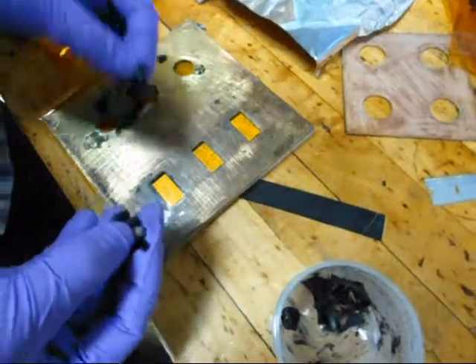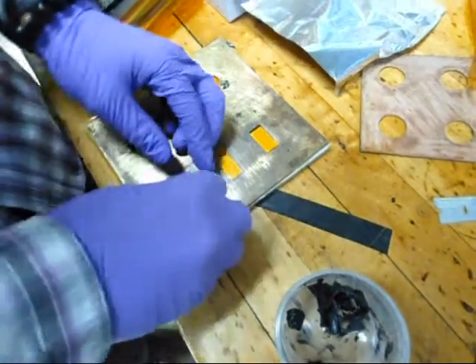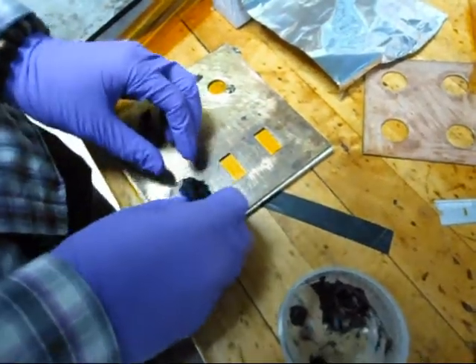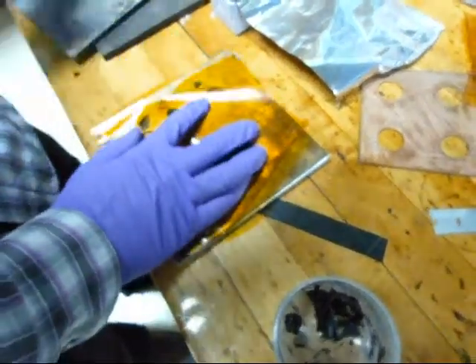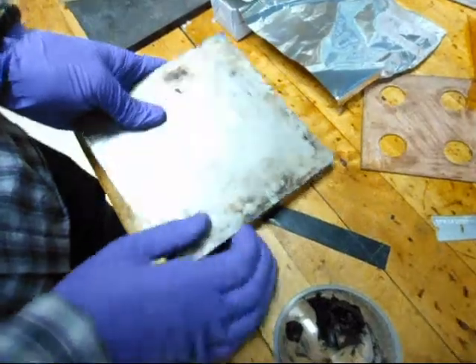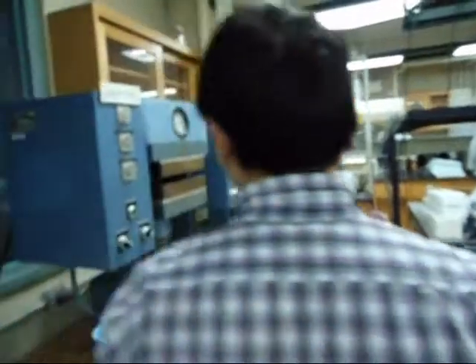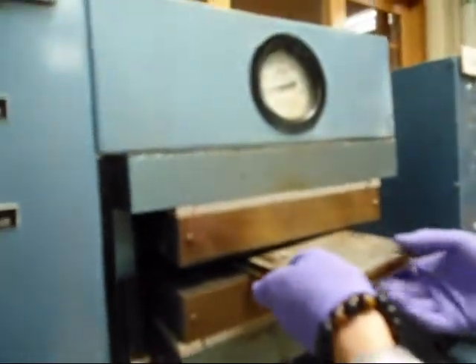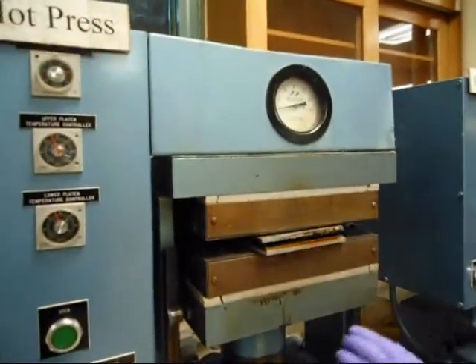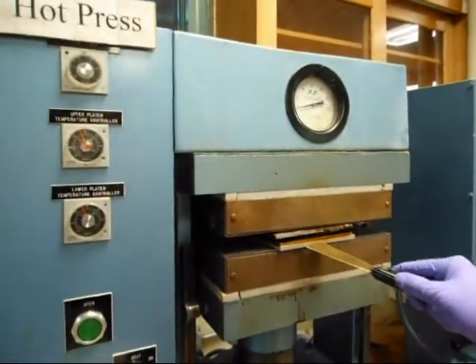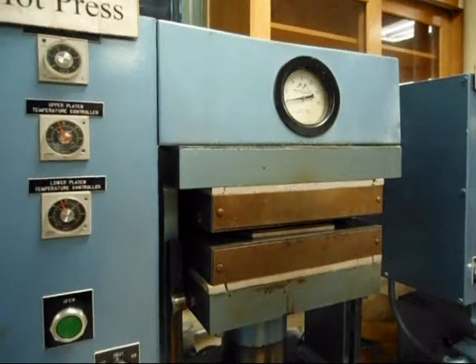This is the mold we are going to use. We fill the hole with the pellets of the rubber composite. Now, we put the mold into a hot press. The hot press has been preheated to 130 degrees.